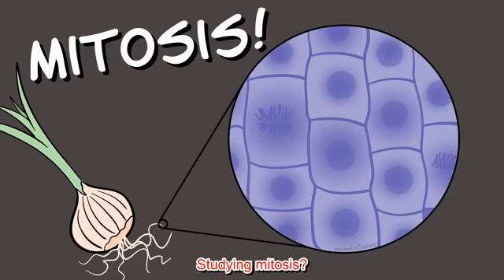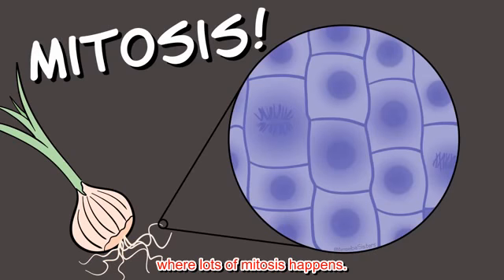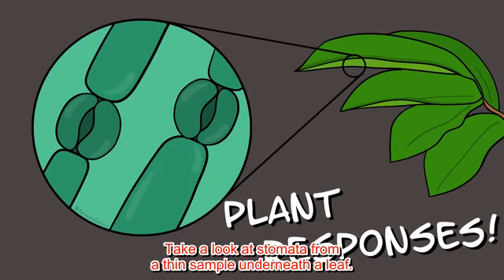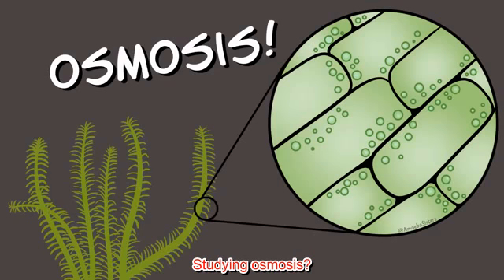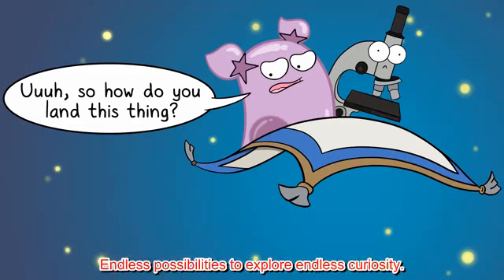Studying mitosis? Check out the cross-section of an onion root tip where lots of mitosis happens. Studying plant responses? Take a look at stomata from a thin sample underneath a leaf. Studying osmosis? Take a look at how aquatic plant cells respond to different salt concentrations. Endless possibilities to explore endless curiosity.